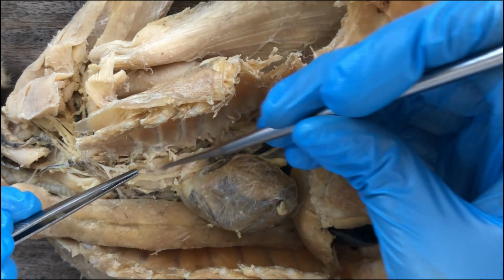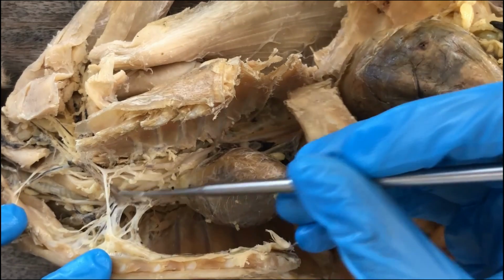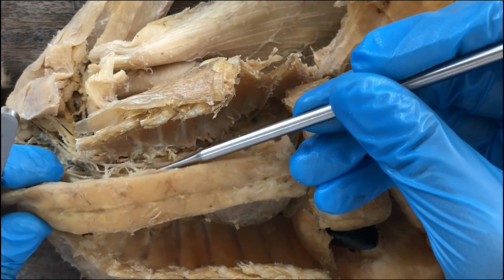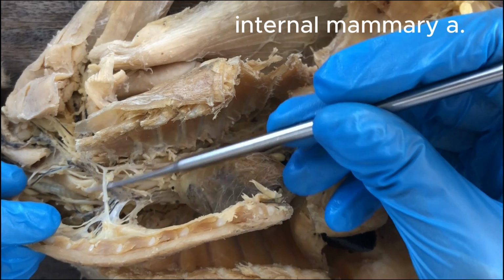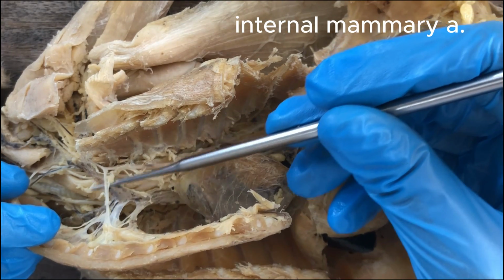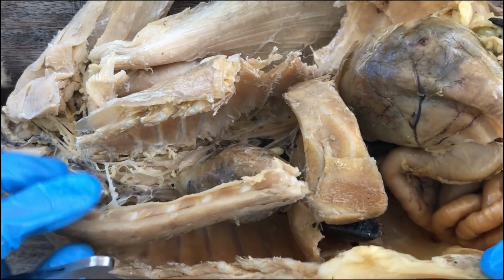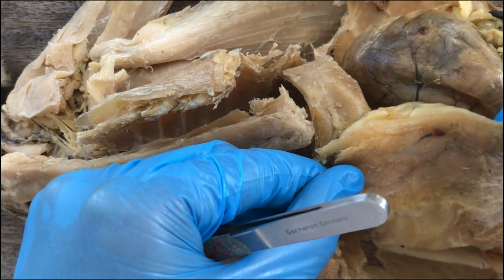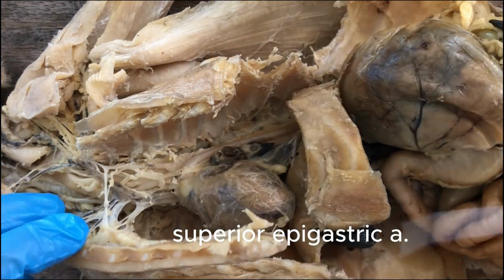Left subclavian artery, and one branch going to the sternum is the internal mammary or internal thoracic artery. Once it reaches the abdominal wall, it will become the superior epigastric artery.